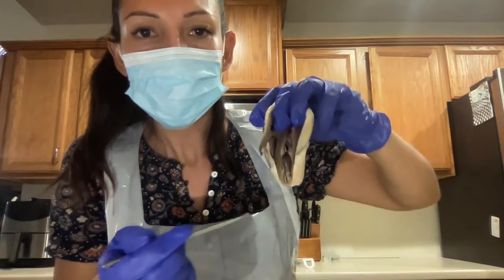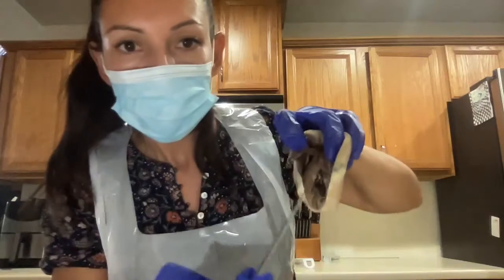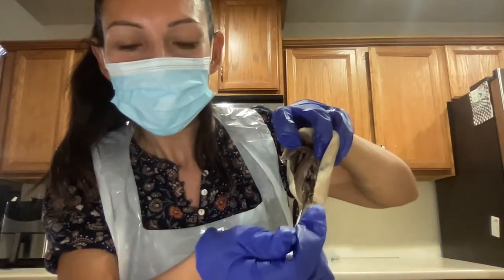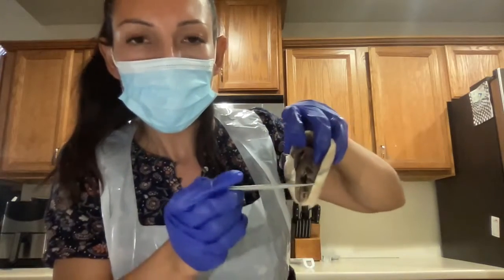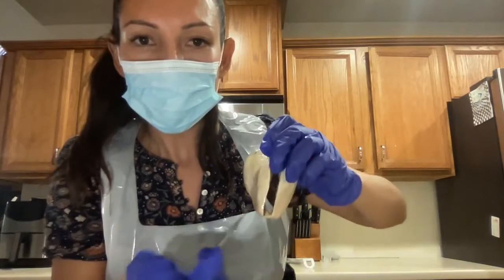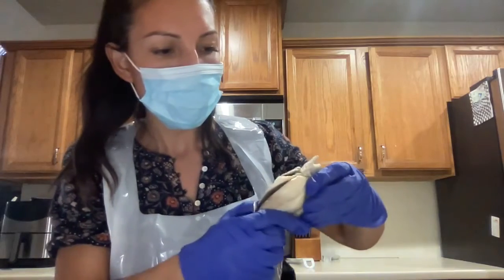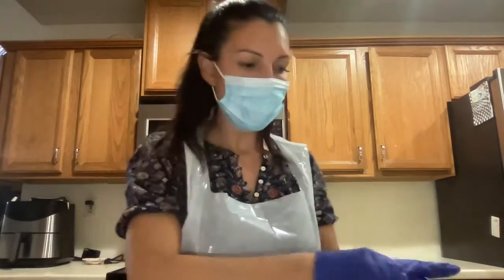Okay, and down here, the chorda tendineae and the papillary muscle. Yeah. And I don't know if I mentioned before, the ventricular wall. So the ventricular wall on this side and also on this side on the bottom would be the ventricular wall. All right. So those are the structures of the heart.